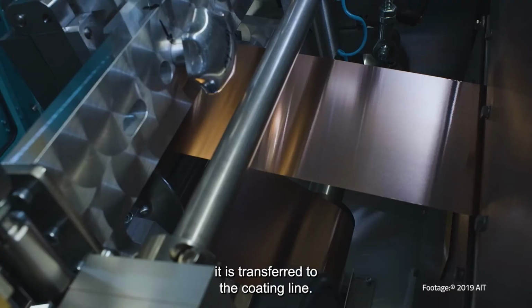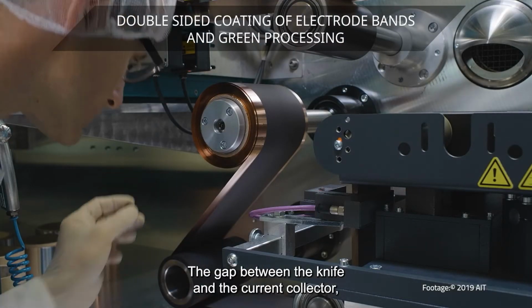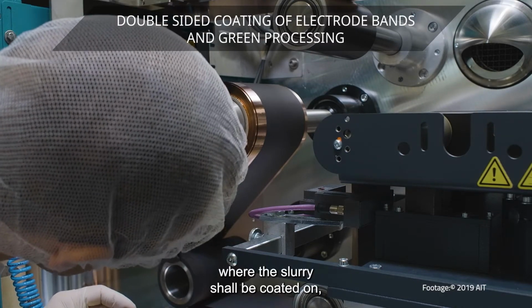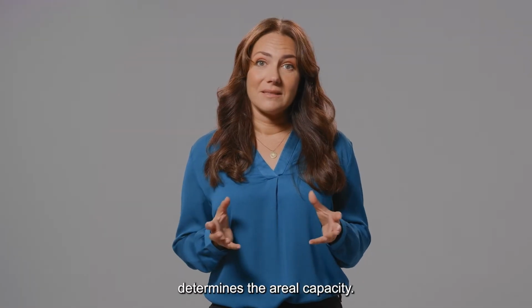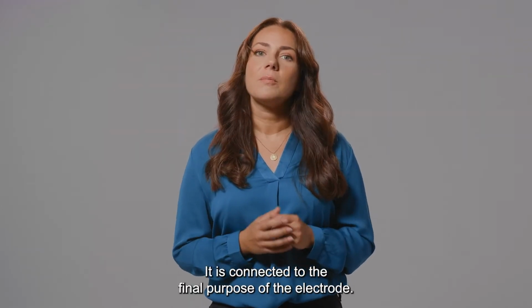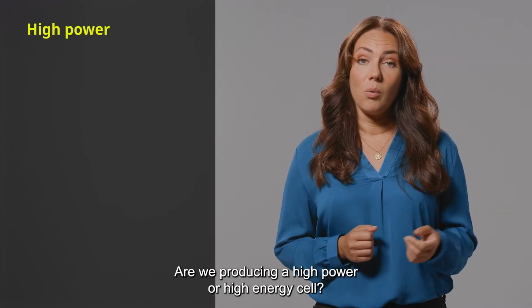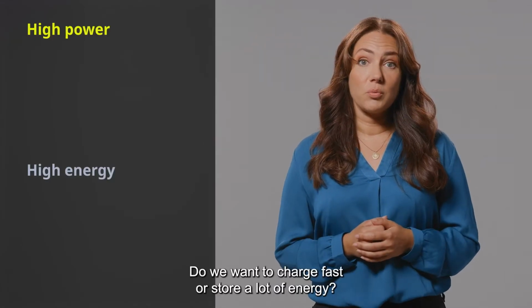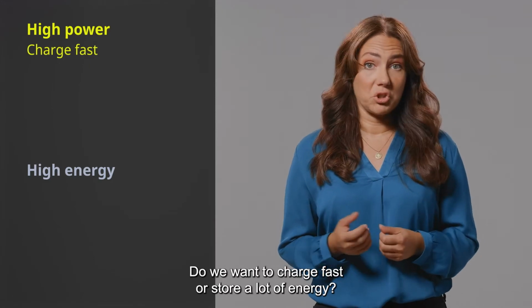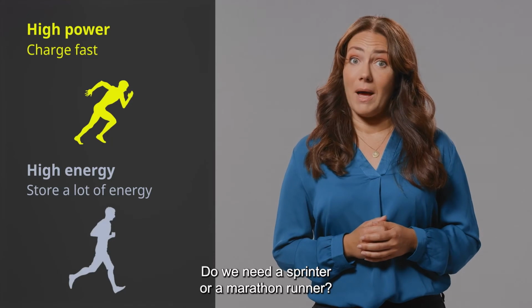After the mixing has finished and the slurry has the desired texture and viscosity, it is transferred to the coating line. The gap between the knife and the current collector, where the slurry shall be coated on, determines the areal capacity. Why is this important? It is connected to the final purpose of the electrode. Are we producing a high-power or high-energy cell? Do we want to charge fast or store a lot of energy? Do we need a sprinter or a marathon runner?